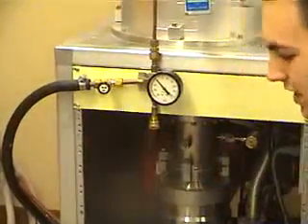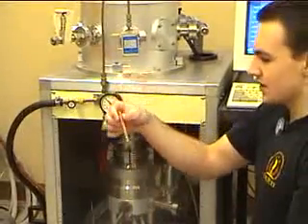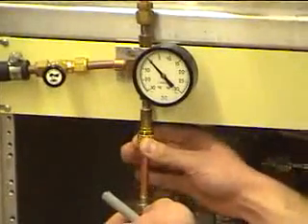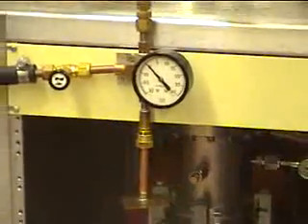Once that's done, you can pour a liquid into one of these apparatus, and some of the liquid might vaporize, so you can repeat this process with the liquid, or you can use any other substance that you want.